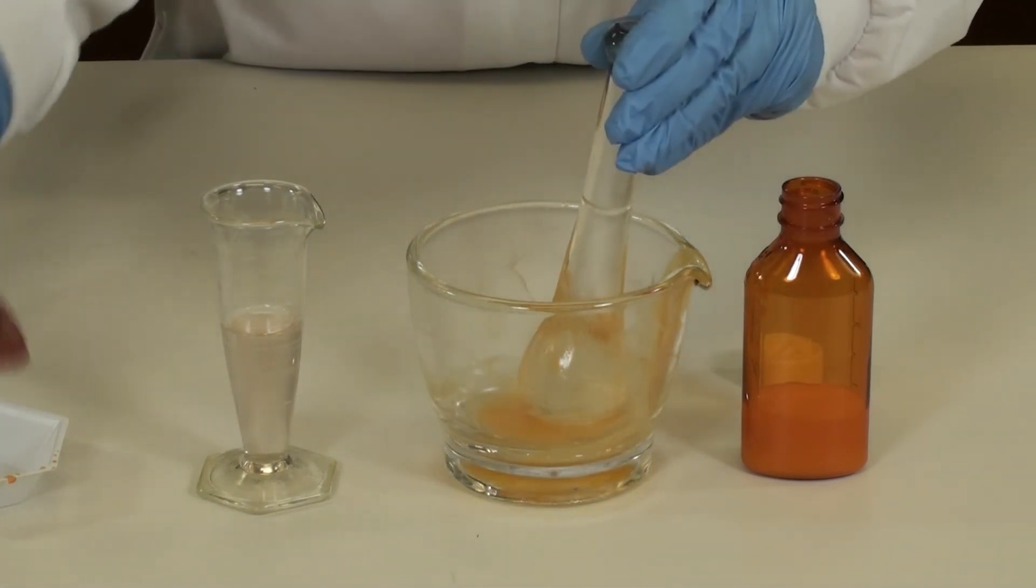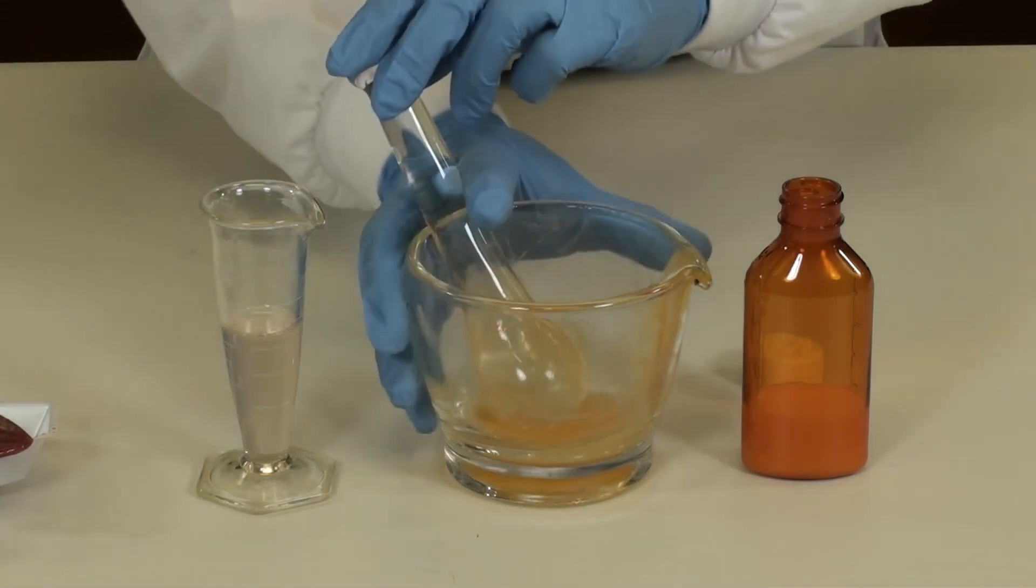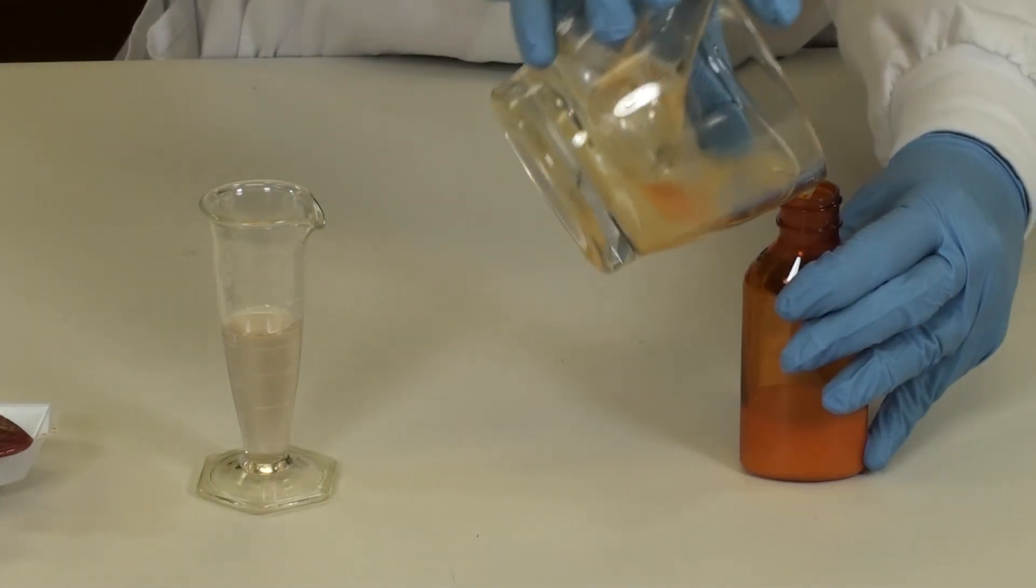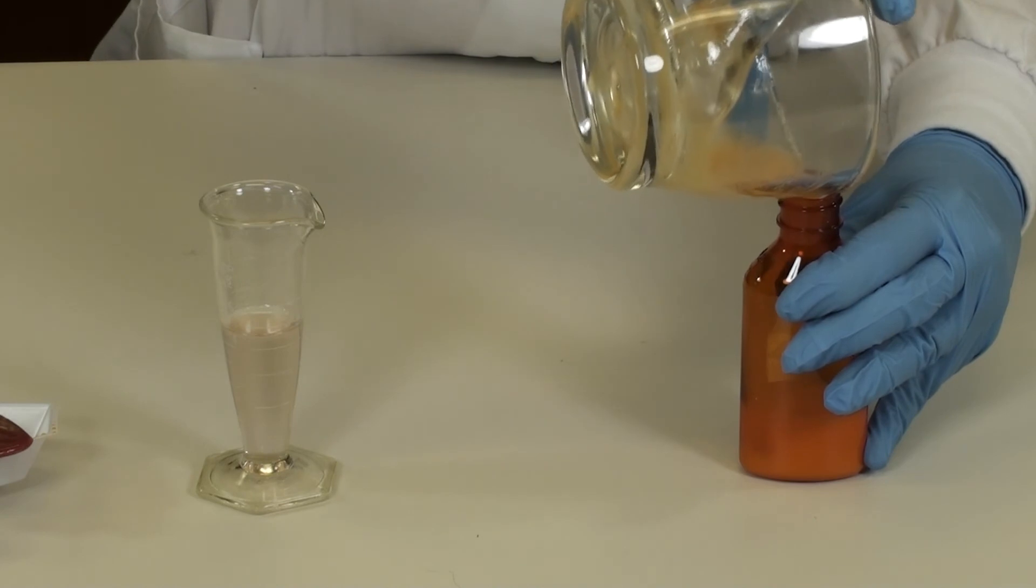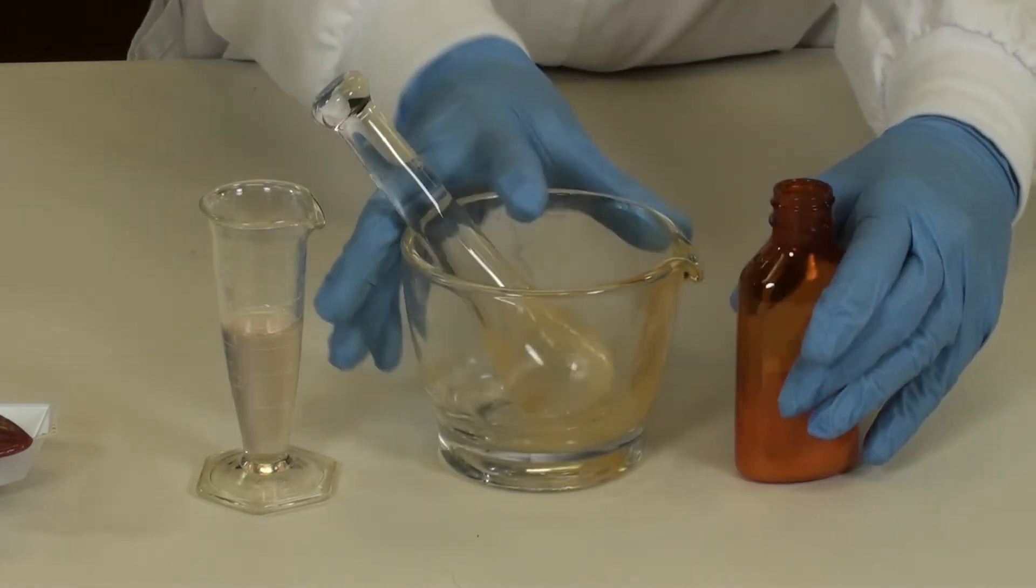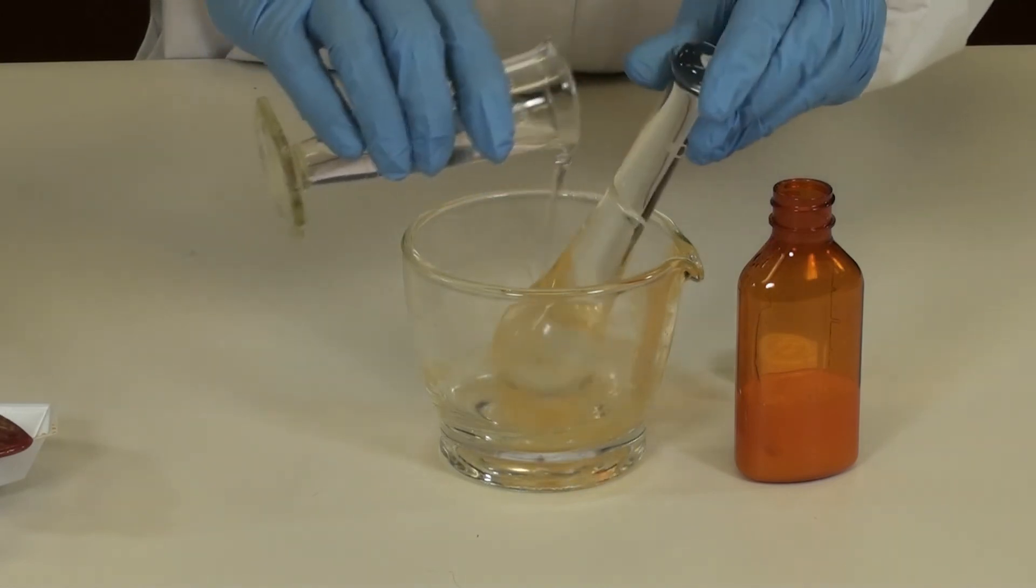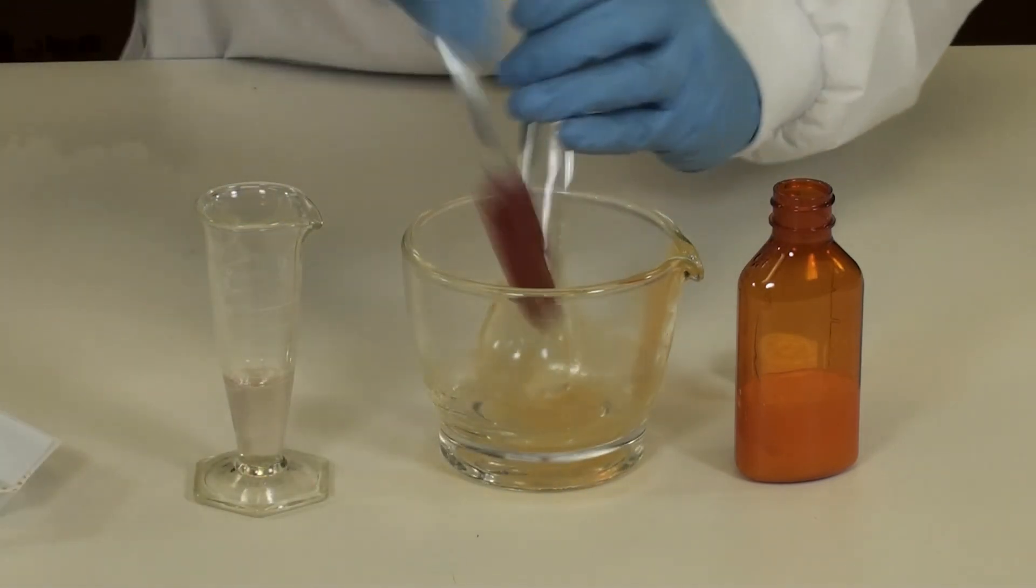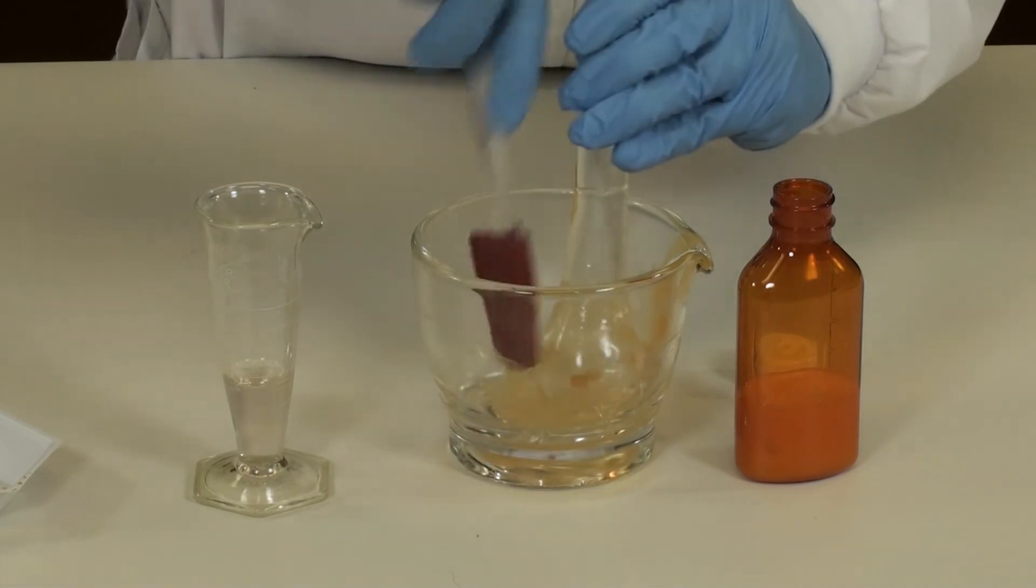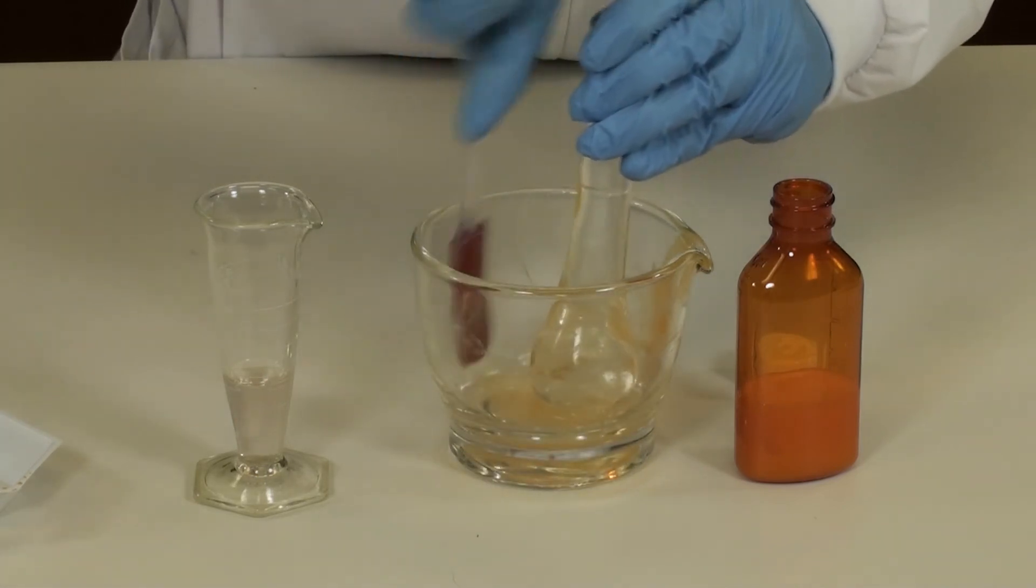In this particular product, when you don't see orange, you will know that you have rinsed all the drug from the mortar and pestle. You will need to rinse two or three times in order to remove the drug and dispense the entire amount for the patient.